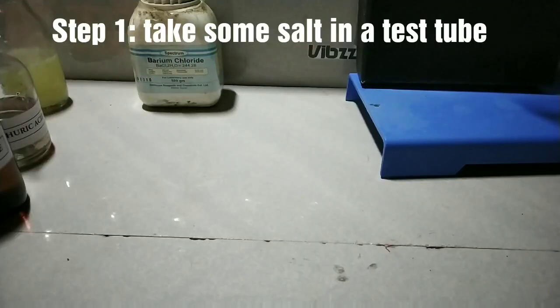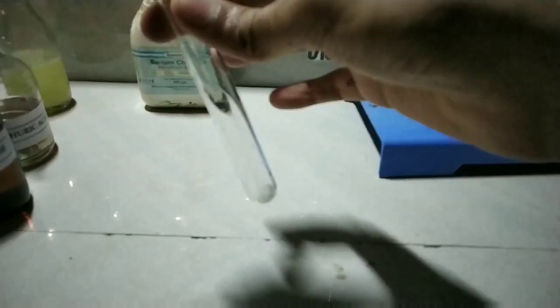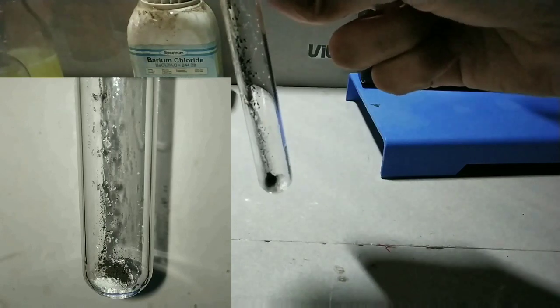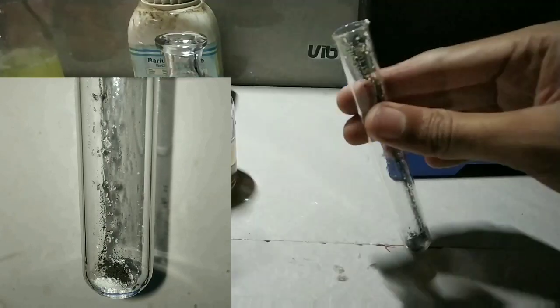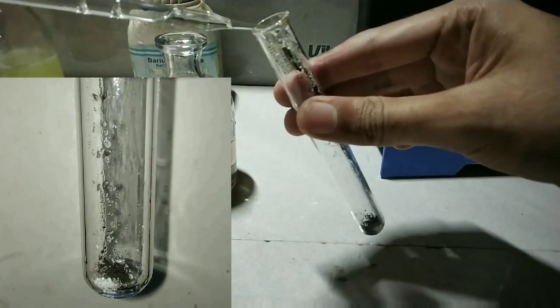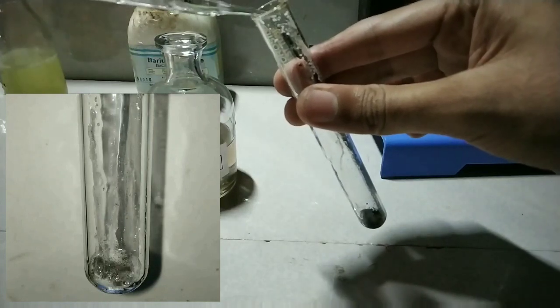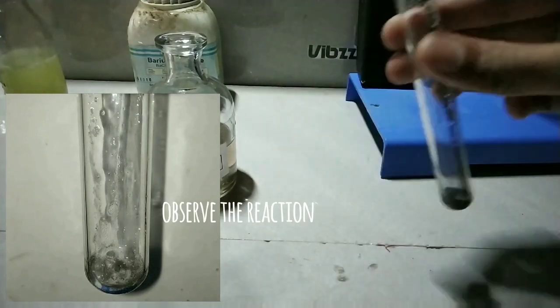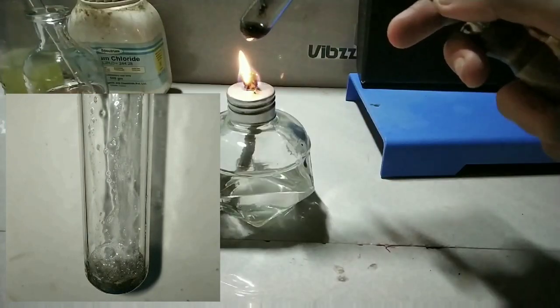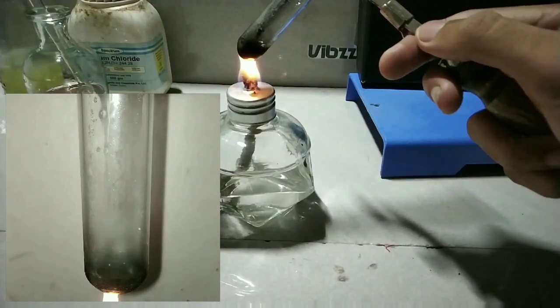Step one is to take some solid salt in a test tube — I have already done that. Step two is to add a pinch of manganese dioxide powder; manganese dioxide is a black colored powder. Step three is to add a few drops of concentrated sulfuric acid. You should always add concentrated sulfuric acid very slowly, as it is very corrosive.